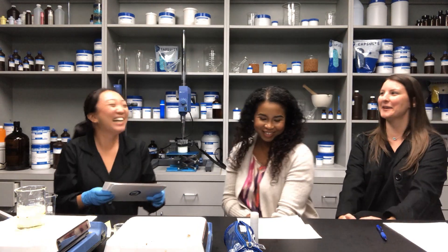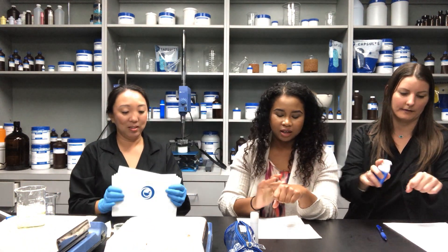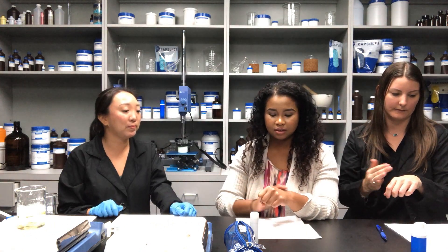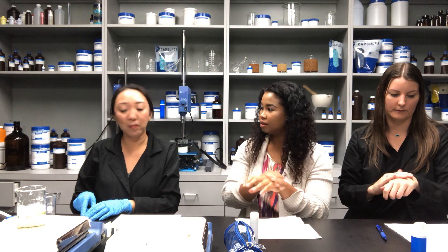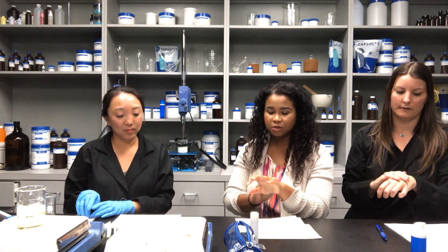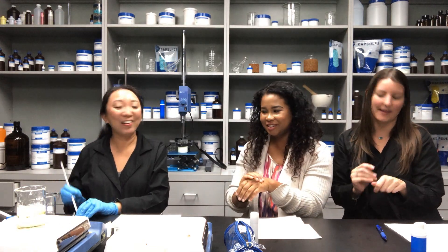That's science! Based on the formula, you cool it all the way down and keep mixing it to maintain the emulsion stability. After that you fill it — typically in a pump bottle or any cosmetic-type jar you have. I have one already filled if you guys want to try it. It goes on nice and smooth with a nice texture. It's not oily at all. It's really light — you can definitely use it on your face. It almost has a little bit of a cooling effect, and it's not tacky.